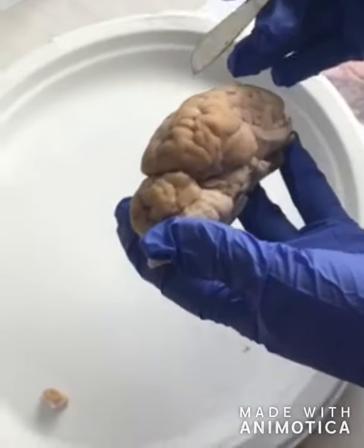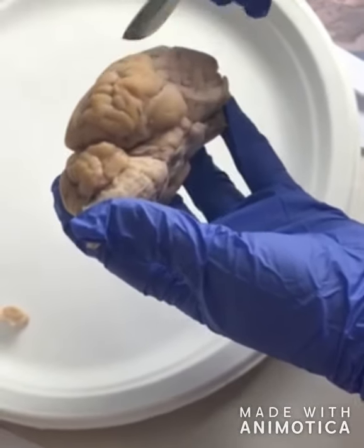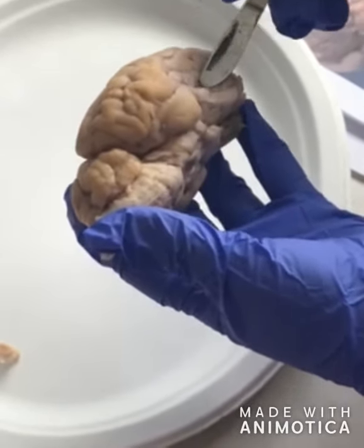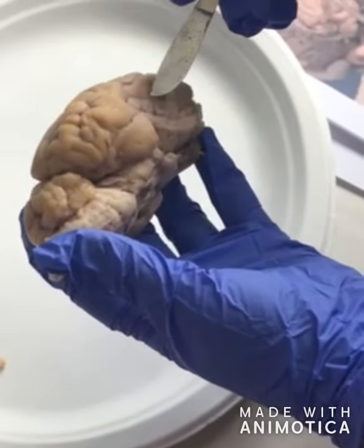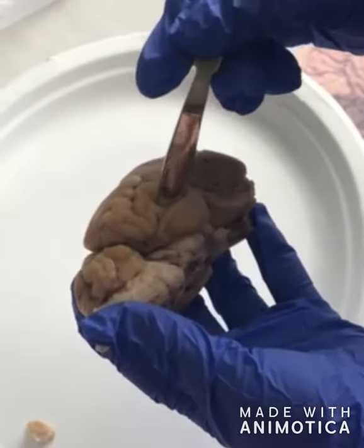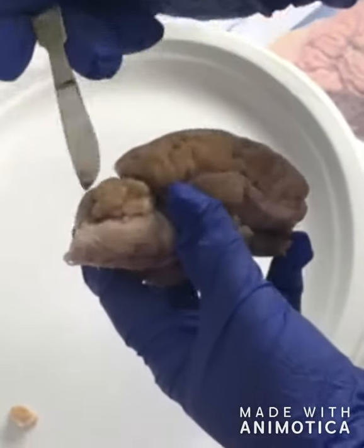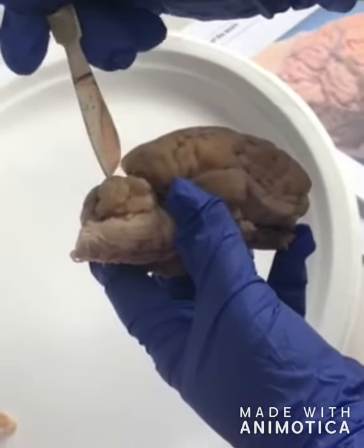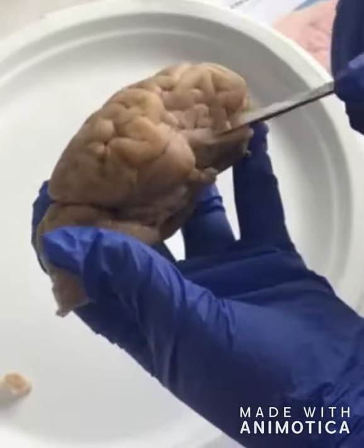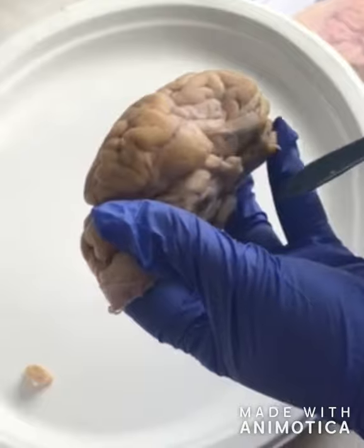Now we're going to talk about the lobes of the brain. So here we're going to have a frontal lobe, which plays a part in smell plus dealing with motor function. And then we have the parietal, which is this section here, that handles all sensory info except for vision, hearing, and smell. And then we have the occipital lobe, which is this piece right here. It receives and interprets visual and sensory messages. And then right here below, we have a temporal, which is involved in hearing and smell.